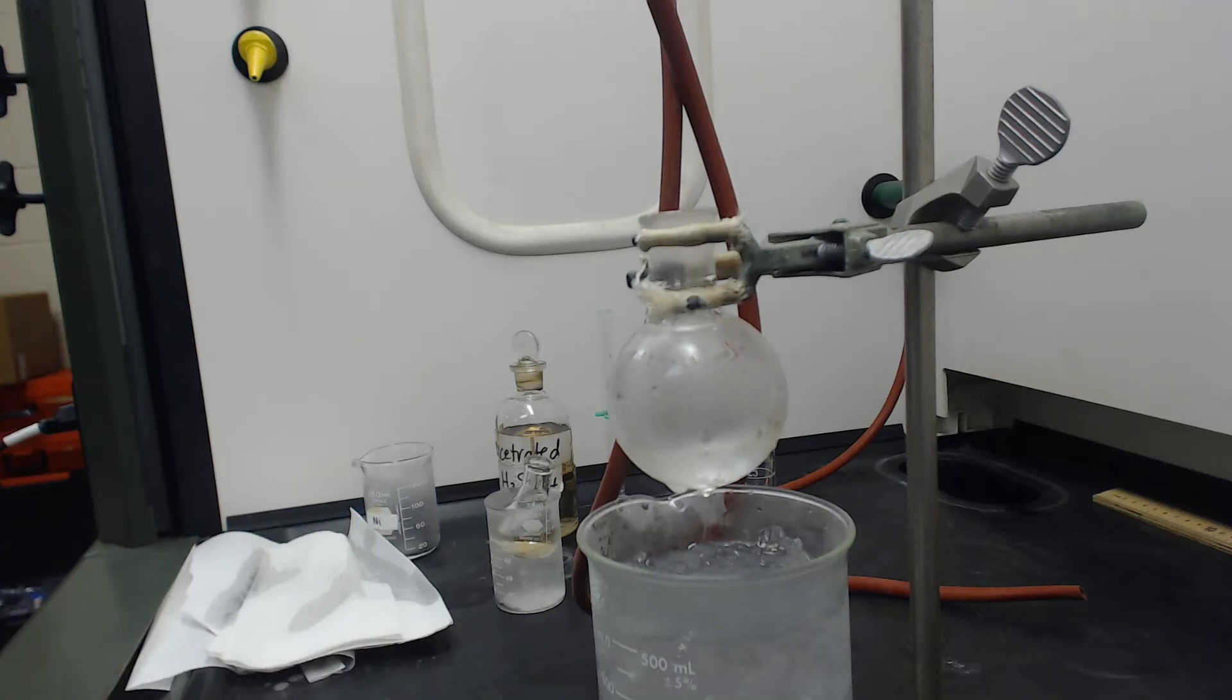Hello, we are doing an SN2 reaction synthesis of 1-bromobutane. I hope you can hear me alright. I don't have my microphone, so I'm just shouting at the computer. Hopefully you've read the introduction.